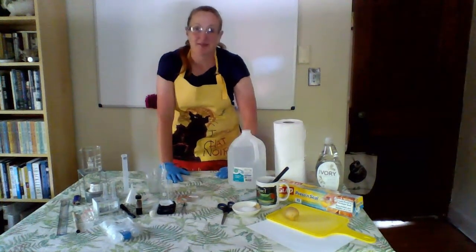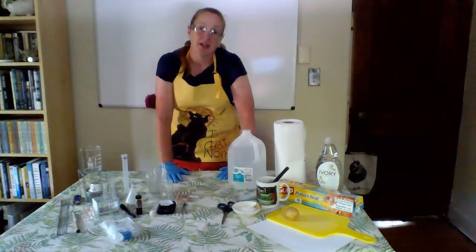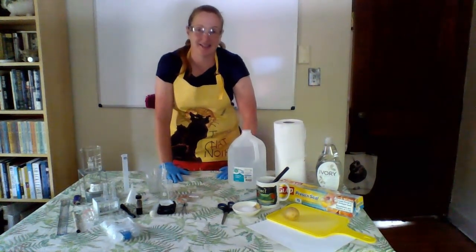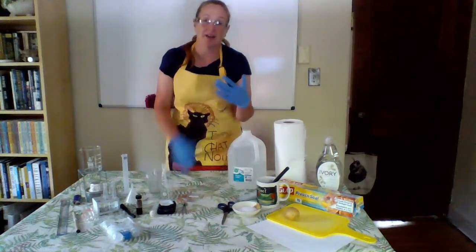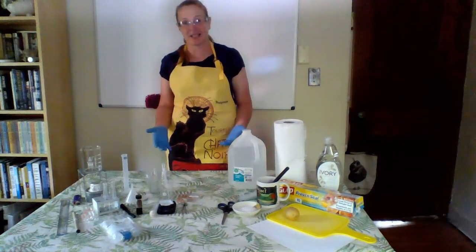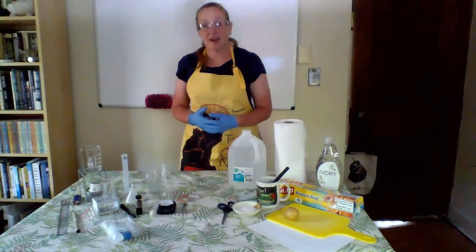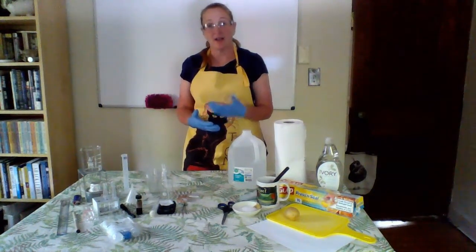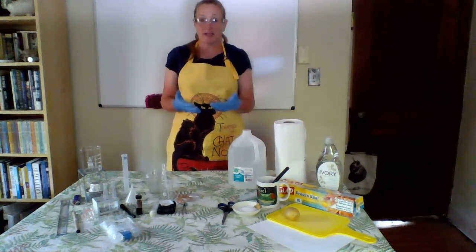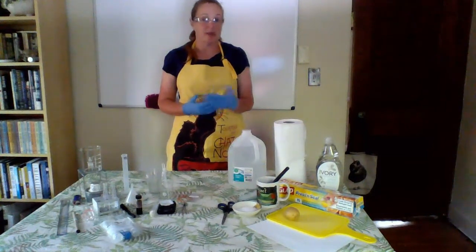Now, whenever we're dealing with simple diffusion or osmosis, molecules need time to be able to move. And so one of the things we need to do is set it and forget it. We do this a lot in science. It's not unusual for scientists to set up an experiment, go home, come back the next day, and then read the results. Now, for this experiment, we don't have to wait quite that long, but for experiment 1, we'll set up a sugar solution, we'll get the experiment started, we'll let it sit for 24 hours, and then the next day we'll come in and do a very quick measurement on what might have happened.